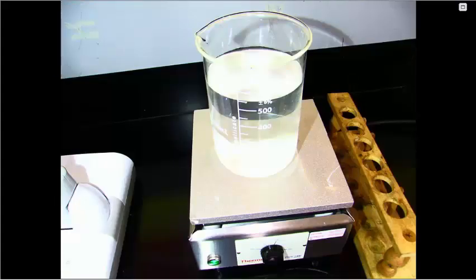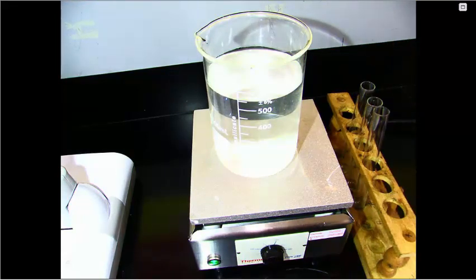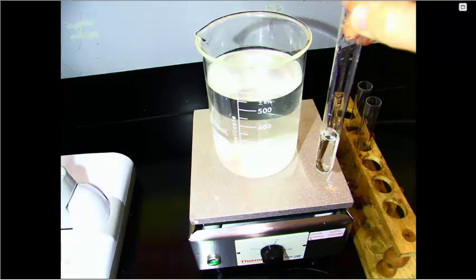For the last test, we will test for monosaccharides. In each test tube, we'll use 3 of them. We will have our known positive, our known negative, and the McMush. Our known positive is a glucose solution. We'll put approximately 3 milliliters of glucose into the first test tube. 1, 2, 3. So approximately 3 milliliters of glucose solution into the first test tube.